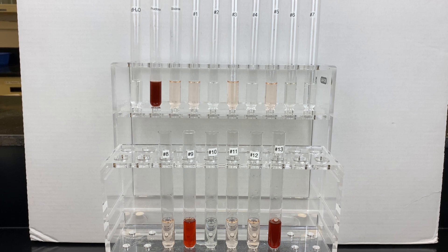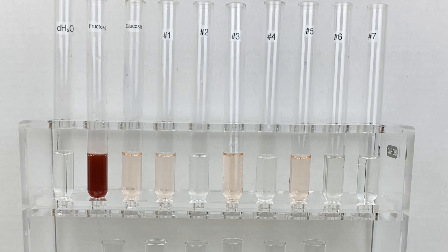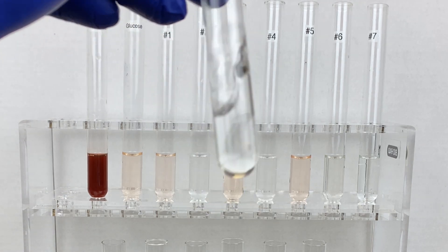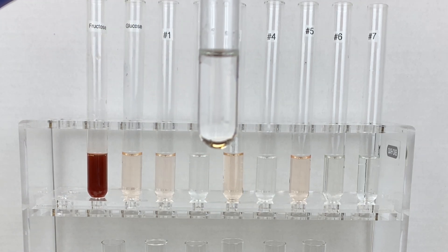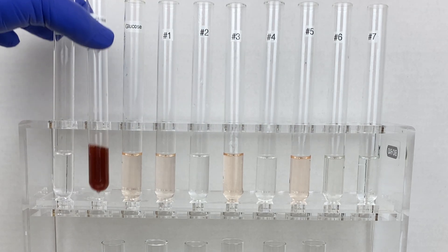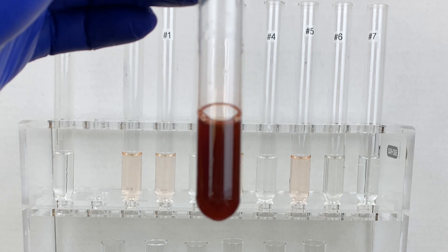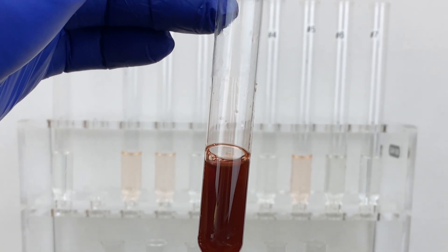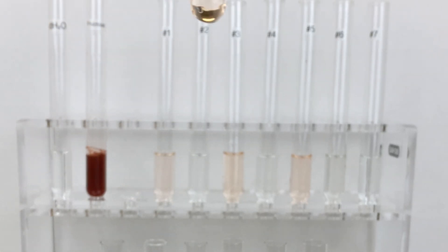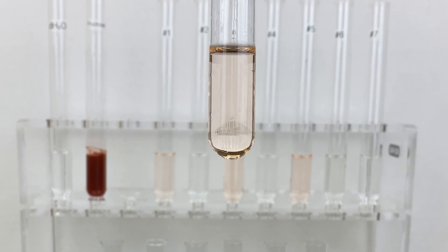Let's take a closer look at each of the samples, starting with our negative control water. As you can see, no reaction has occurred — it appears very clear. Here is our fructose, positive control for ketose, and you can see it is cherry red. Next up is our aldose positive control, glucose, and you can see it is peach in color.